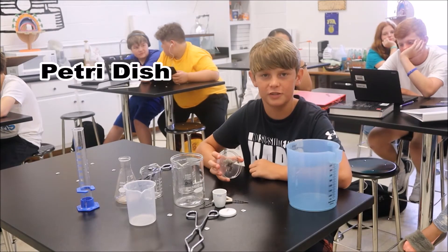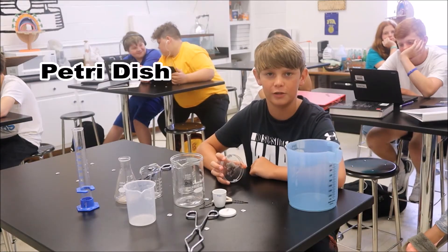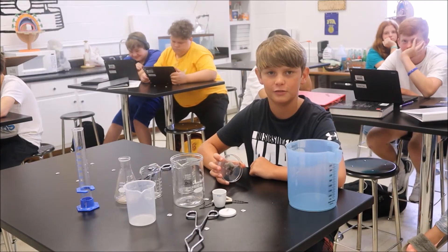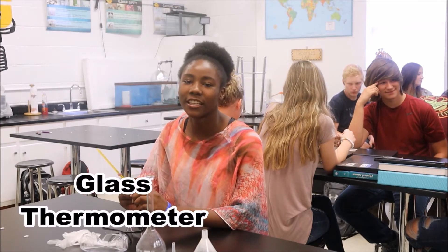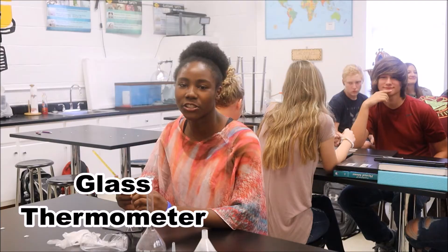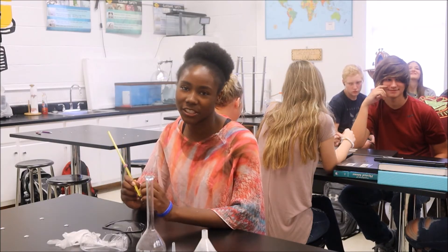This is a petri dish. Specimens to be studied can be placed in it. This is a glass thermometer. It is used to measure temperature with a high degree of precision.